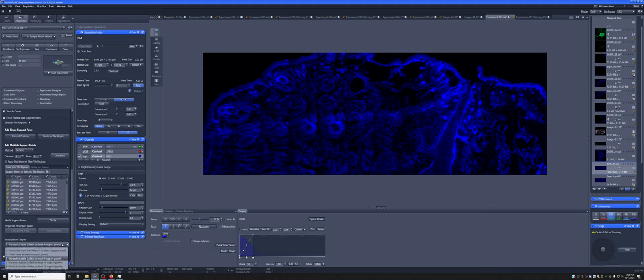There are other things that you can do. You can change the type of support surface you have. You can make it a tilted plane, or you can make it something that can be more wavy. That's something that you have to check on your end, what the best model is, but this can in general be a very effective solution for cases of tilted samples.